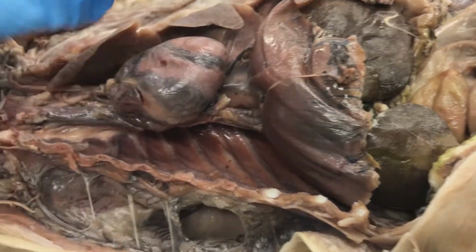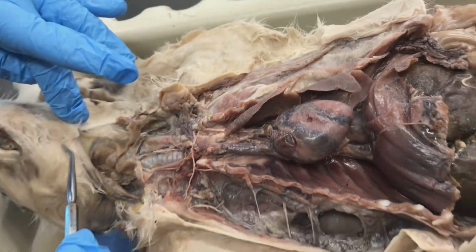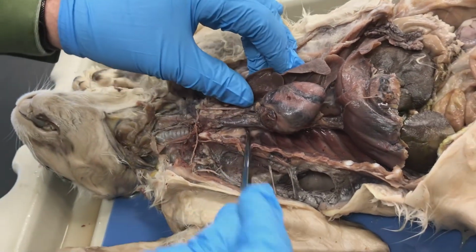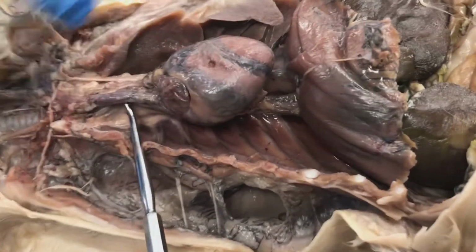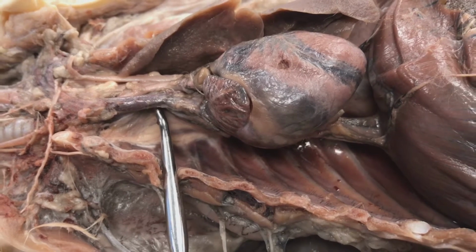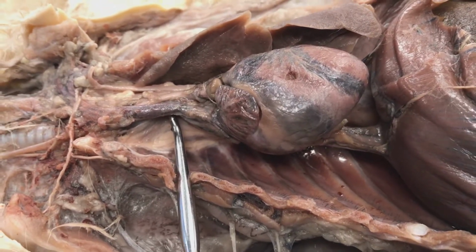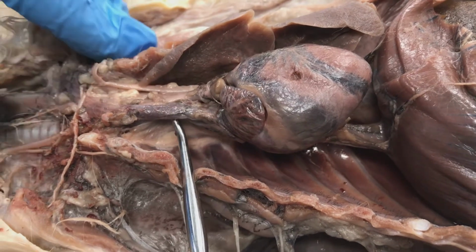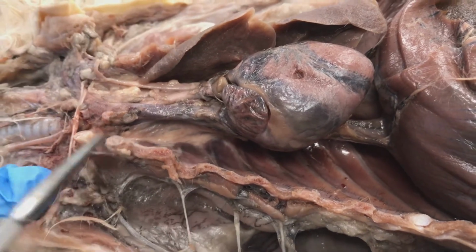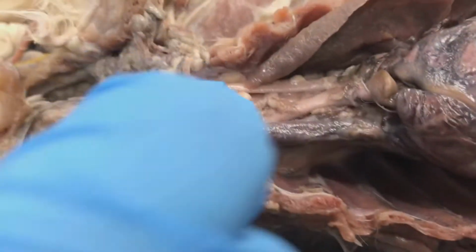Going up here, I have blood feeding from my limbs and head, and then it goes down. And this right here would be my anterior, or superior, vena cava here. And it's fed by different blood vessels. Like for example here, you're seeing it feed this vein right here.